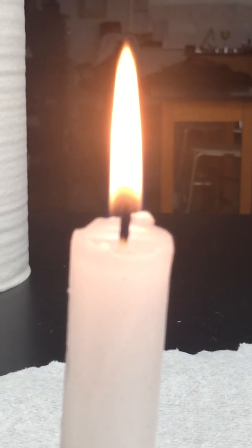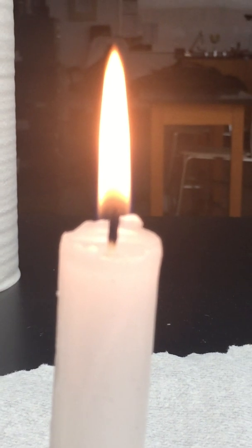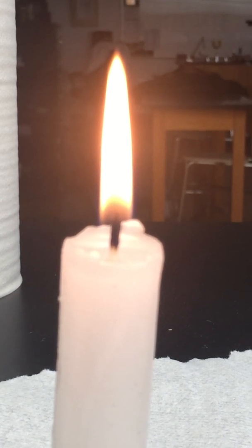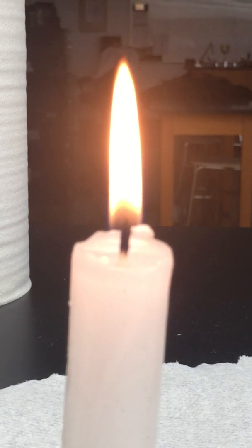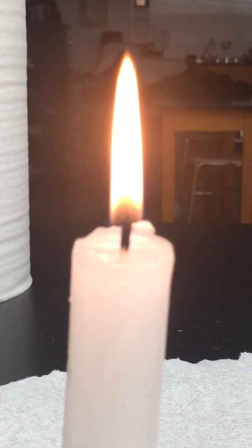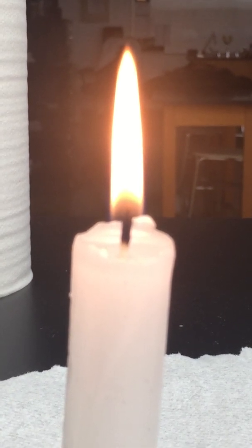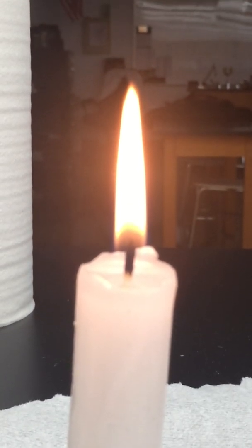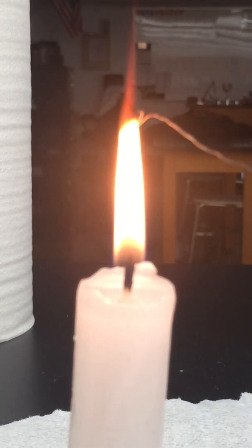This is like a Zen moment. So at this point you could probably fast forward to the end. Well, let's see here. I'm going to use my loop here. Remember how this works.